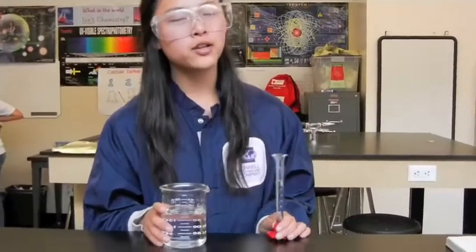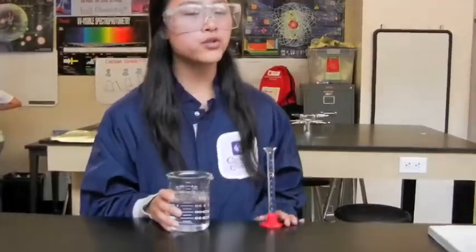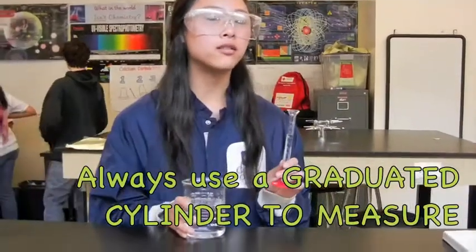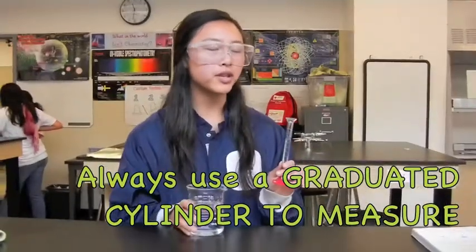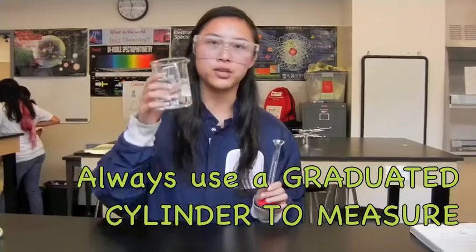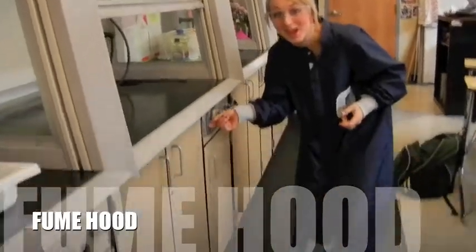So, here we have a graduated cylinder and a beaker. Whenever you're measuring, you always use a graduated cylinder, mostly because it's accurate, and also because Ms. Bauman will yell at you if you measure with a beaker. So keep that in mind. This is a fume hood. You turn it on with this switch.